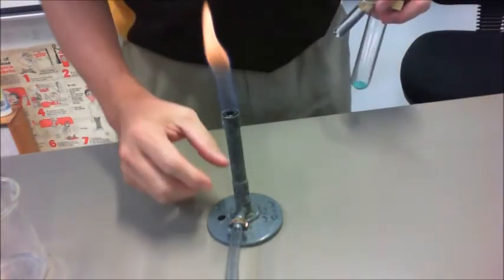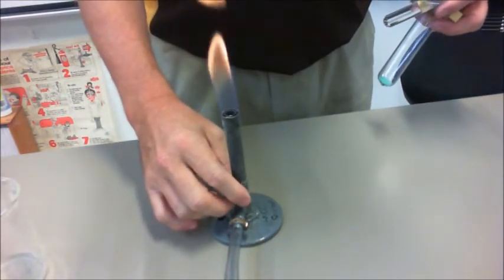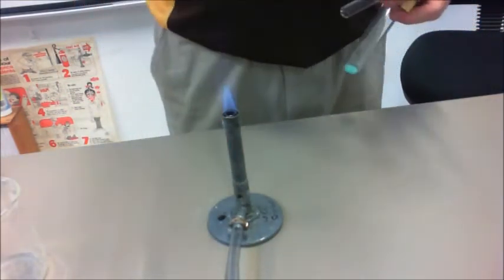Okay, we're about to decompose our copper carbonate, so we put it onto a blue flame.